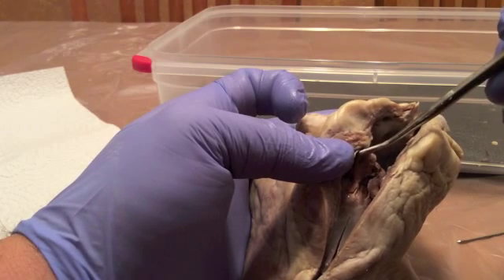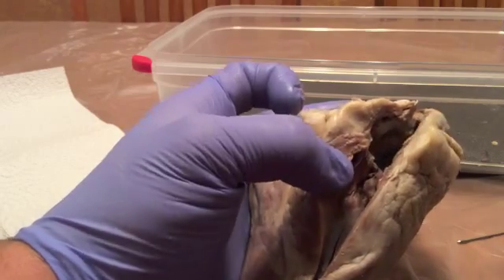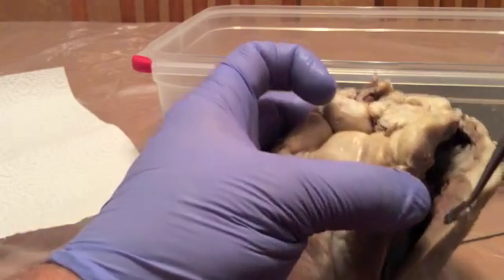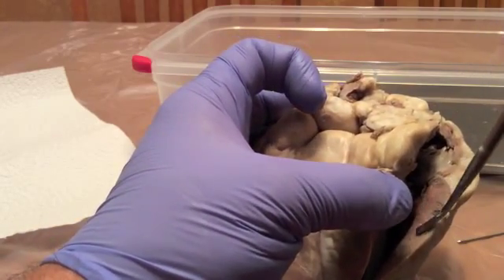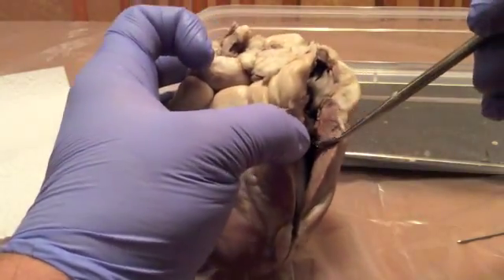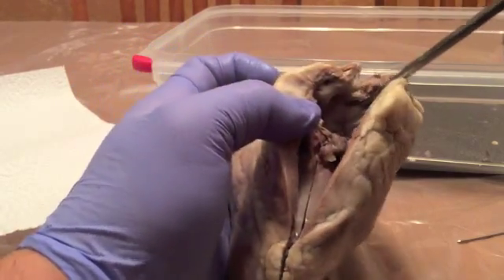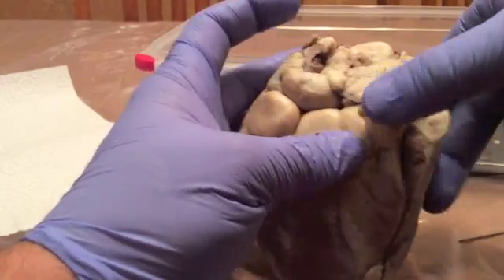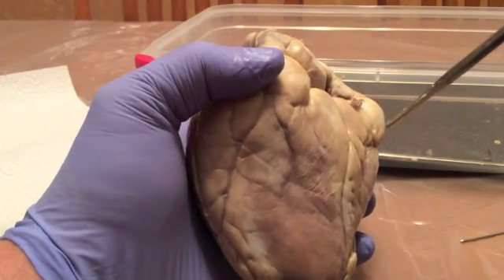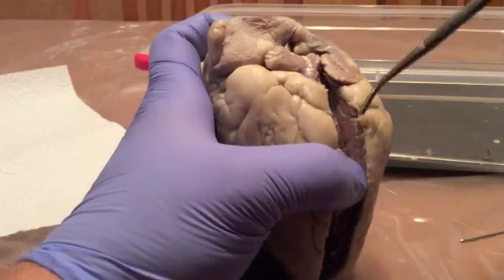The tendinae here help keep the structural stability of the valve itself from prolapsing and allowing back pressure back in the atria when the ventricle contracts. You can see here the myocardium, which is the muscle portion of the heart. It's smaller on the right side than the left, and in a minute I'll be able to show you the difference between the two. That's due to just the job and nature of the difference. The right side is going to be pumping deoxygenated blood back to the lungs, so it's a shorter trip, less pressure.